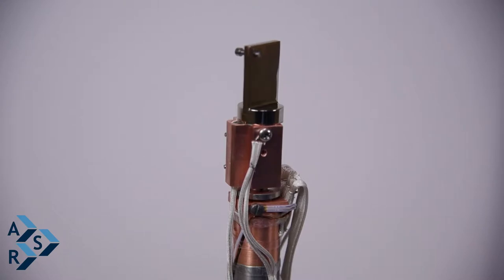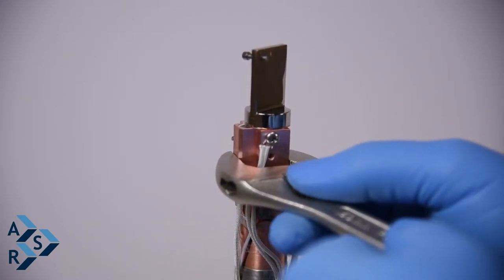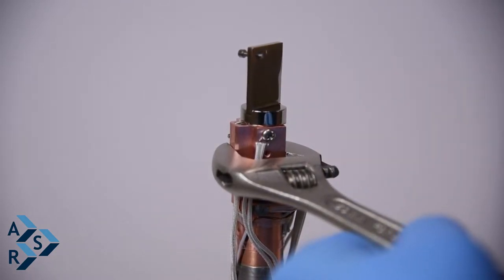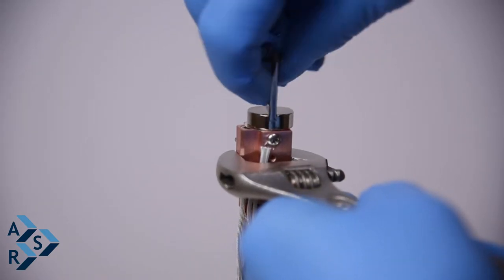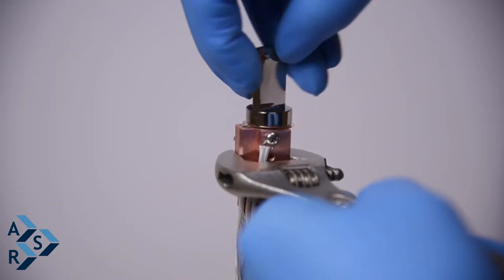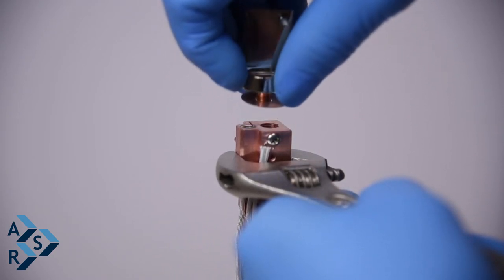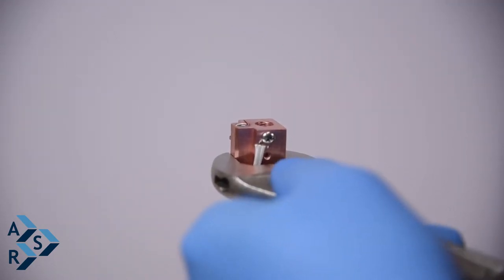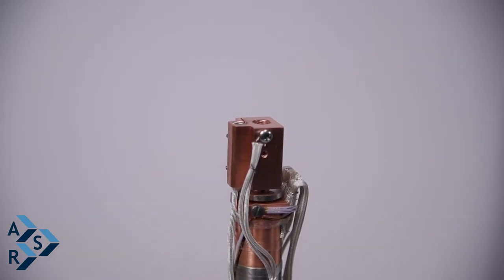Same thing when you're removing your sample holder. We recommend also using an adjustable wrench or some other tool, and slowly loosen the sample holder. And that should do it.